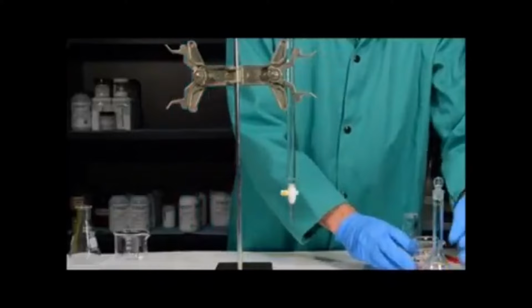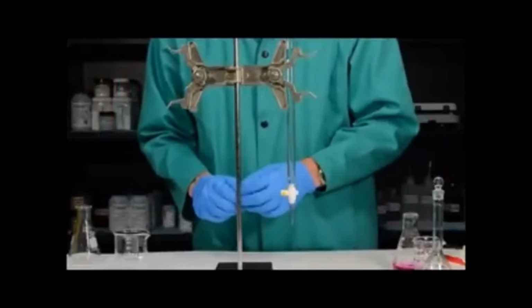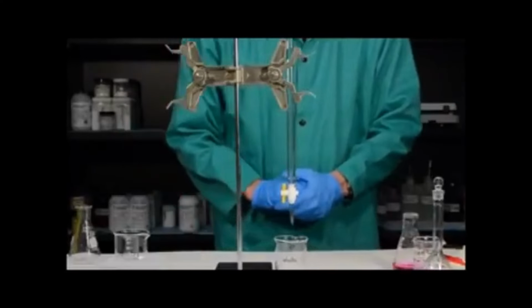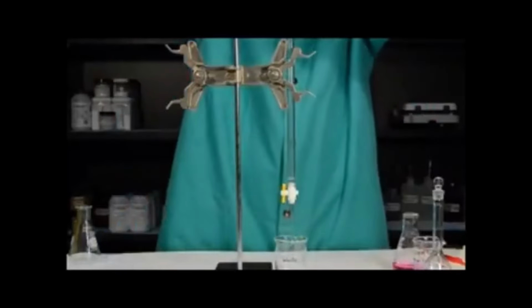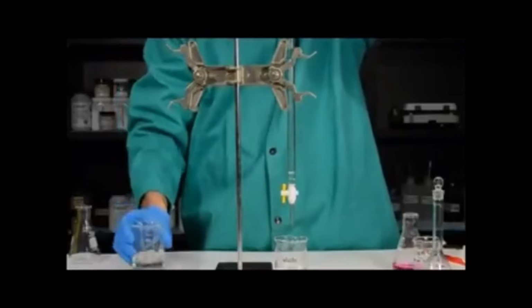Also, as far as cleaning, you need to make sure that you thoroughly clean the burette. To do that, you want to use your waste beaker and drain any excess sodium hydroxide solution, which again would be combined in the waste. Once the solution has been drained, you want to use water and rinse the burette with several portions of water to ensure that there is no sodium hydroxide solution. Sodium hydroxide will clog burettes and ruin them, so please make sure that you thoroughly clean your burette so it's ready to go for the next person.